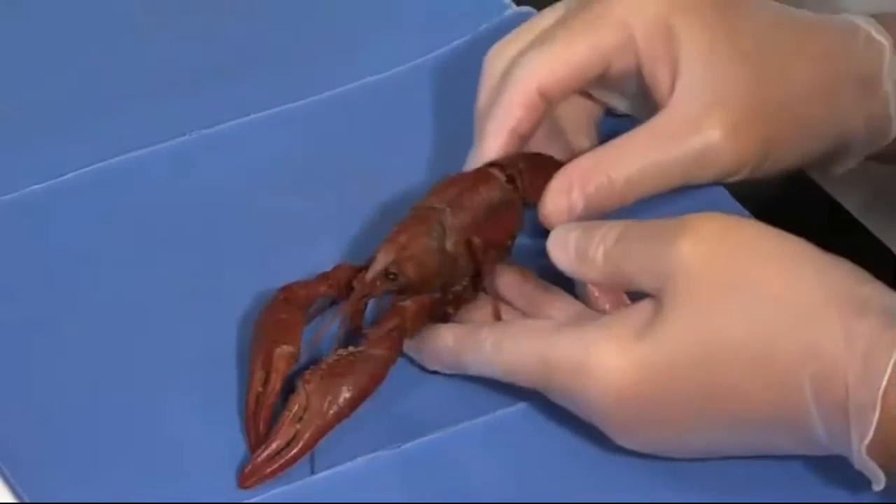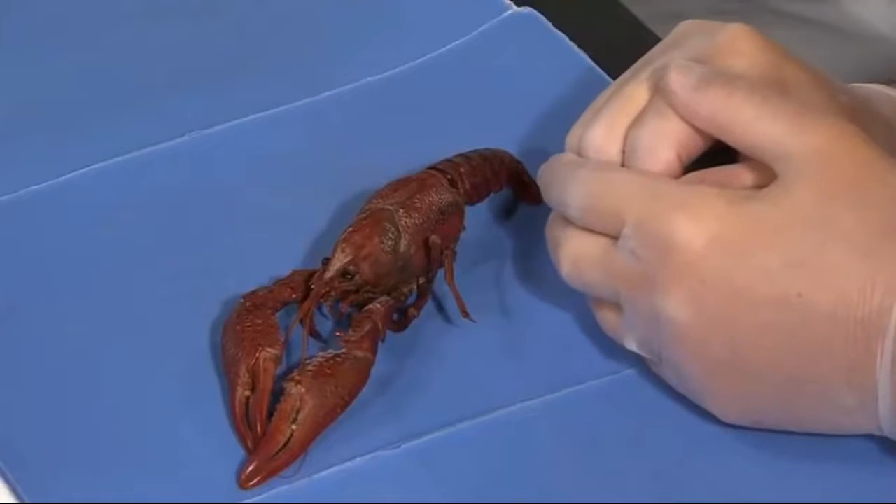Hello, I'm Steven Rakusek with South Dakota Public Broadcasting. I'm Del Droege, Professor of Biology at Dakota State University. And today we're going to dissect the crayfish. Yeah, we're going to look at crayfish today as a great example of a very interesting group of animals, the arthropods.